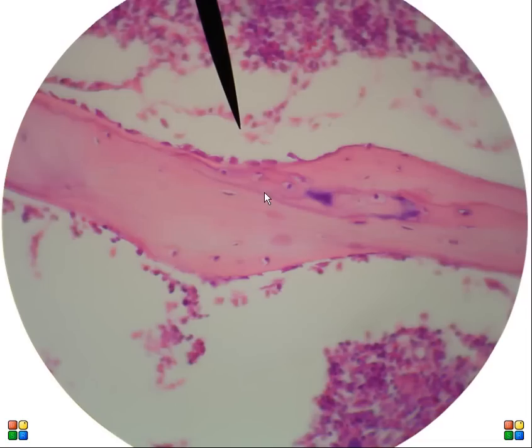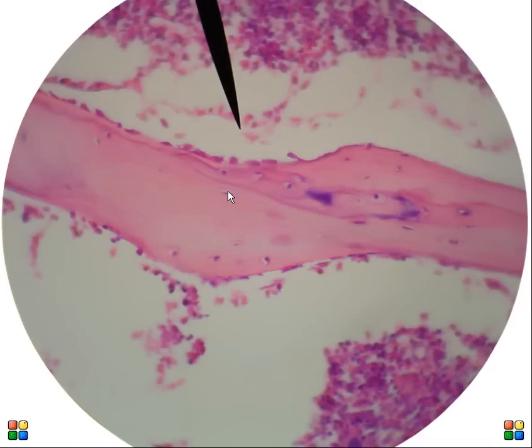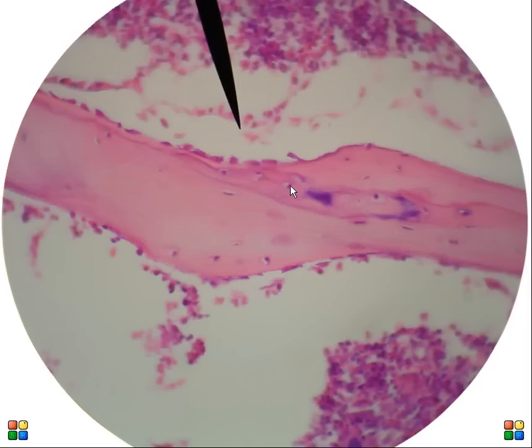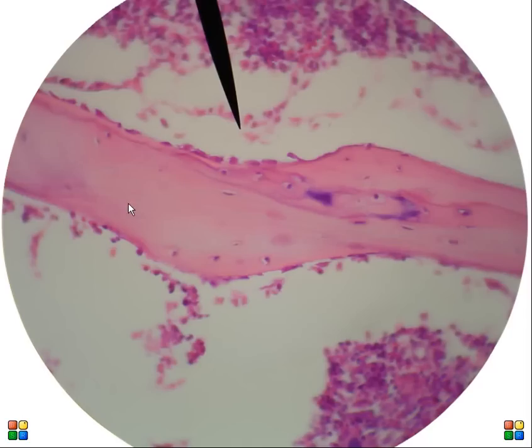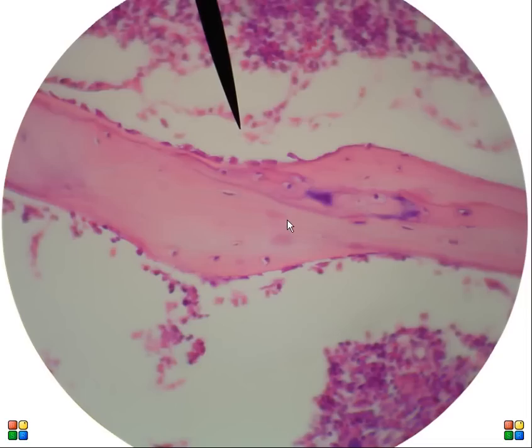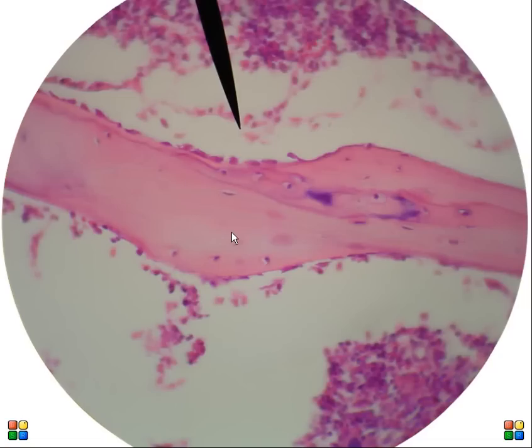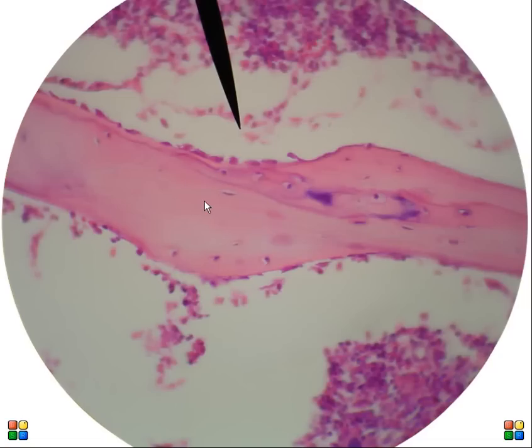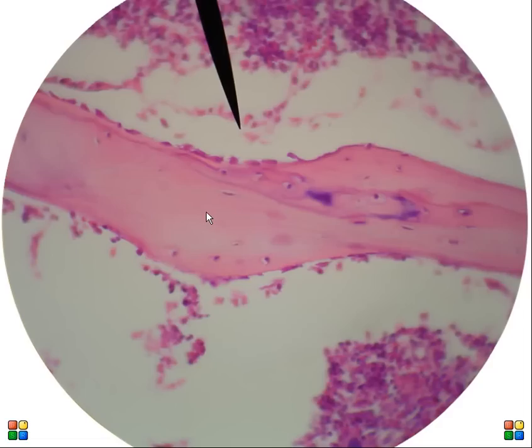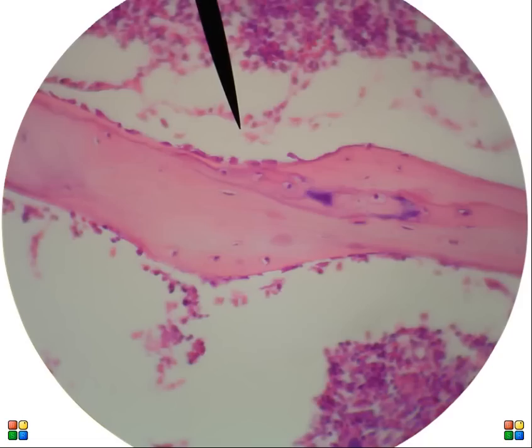Next picture, a good image of the bone tissue within spongy bone. We've got lacuna with an osteocyte living inside of it. Notice that we don't have osteons in the spongy bone — it's not made that way. Compared to the ground bone we saw earlier, this bone has had the calcium removed so they could do tissue slicing on it, which is why it appears very different. It stains well because of mostly the collagen fibers we see in bone tissue.